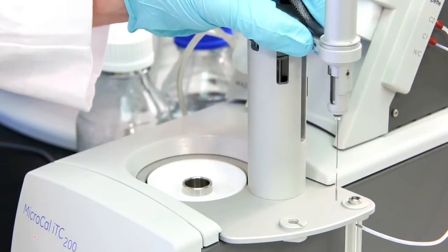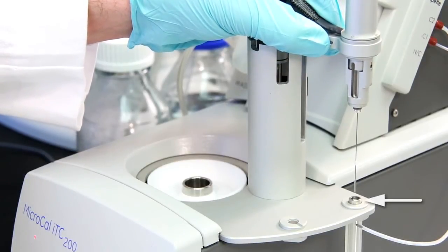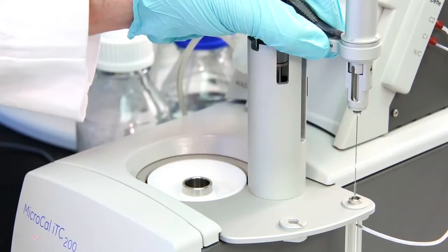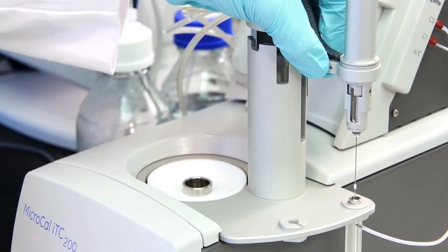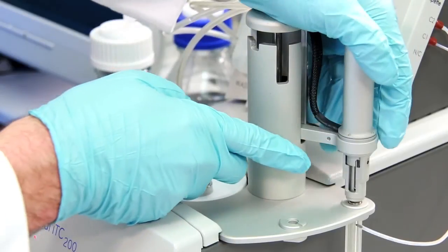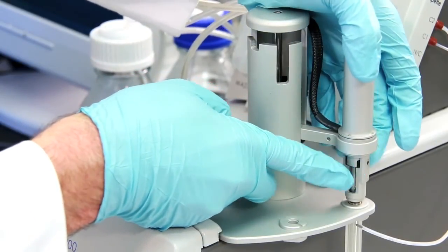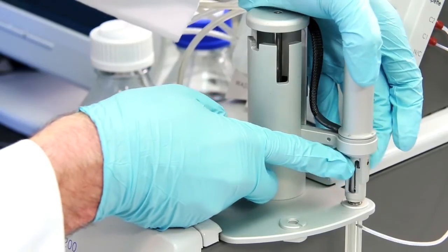Now rotate the pipette to the wash station where our securing nut is still in place. This keeps the nut aligned where we can just drop the pipette into place over the securing nut and rotate the pipette a few times to engage the threads on the securing nut.